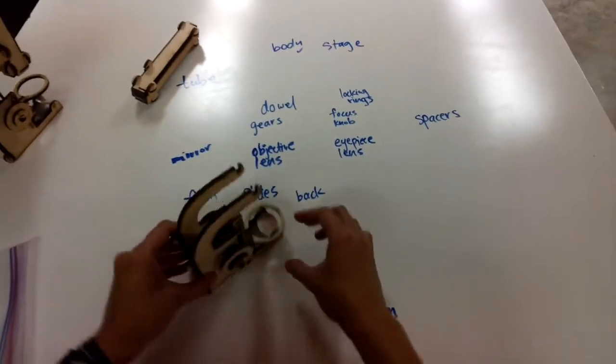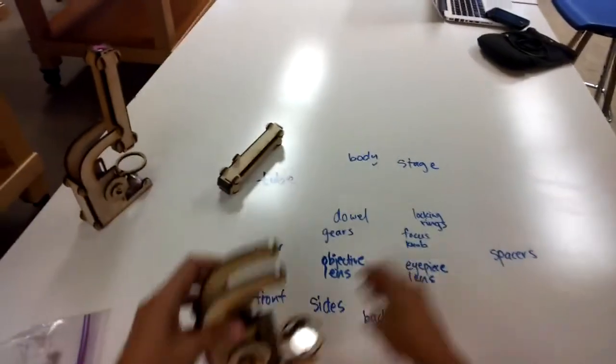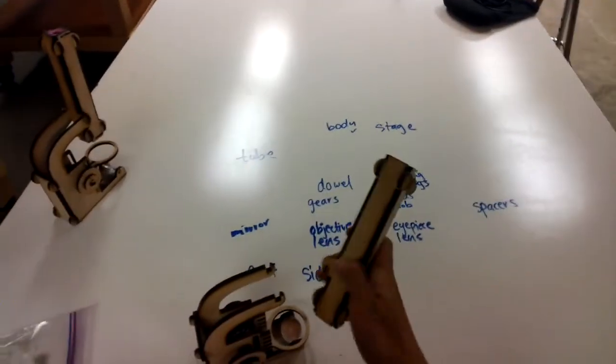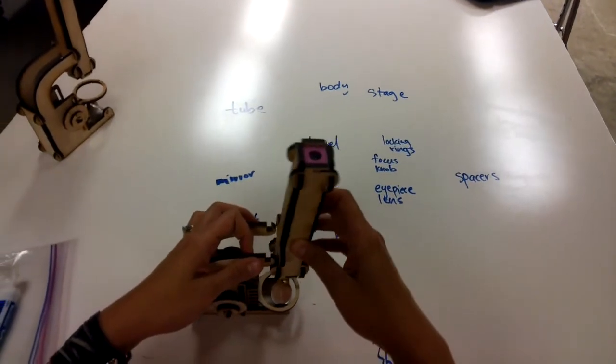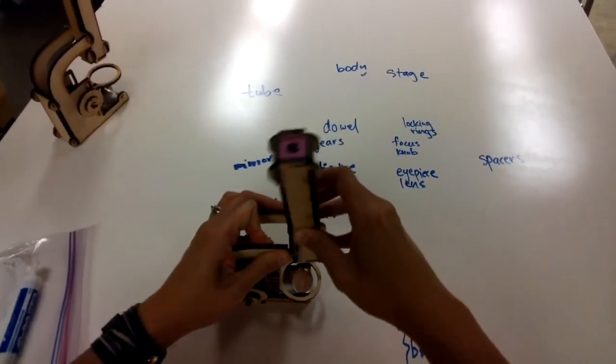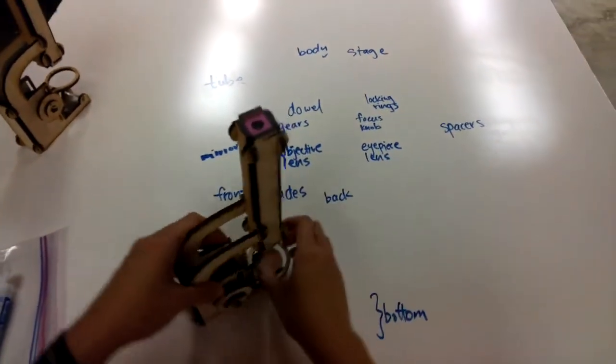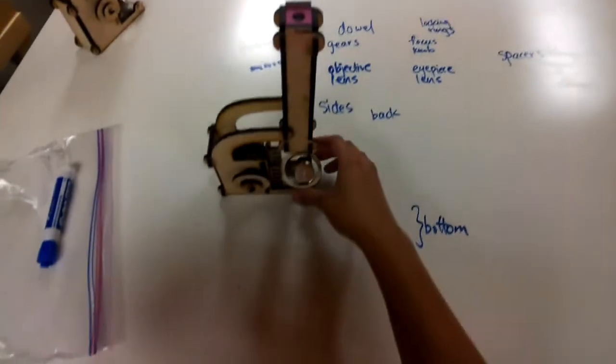Okay, so there's the microscope, the main part of it. And then we're going to add the tube onto it. So this part just slots in. You kind of have to wiggle your way into it. And then the little hooks attach. And you've got a finished microscope.